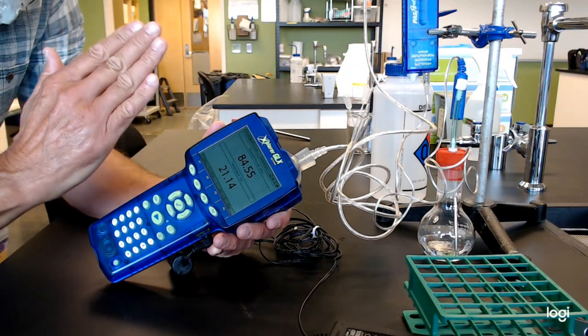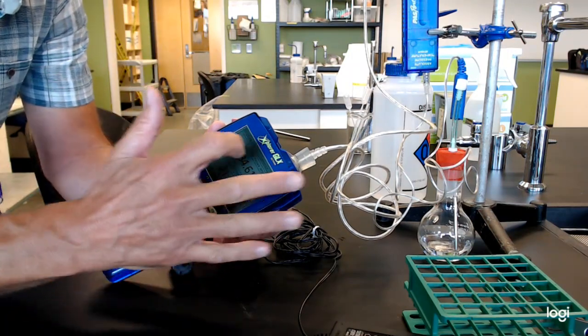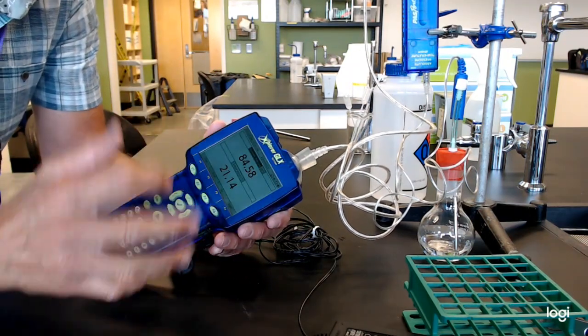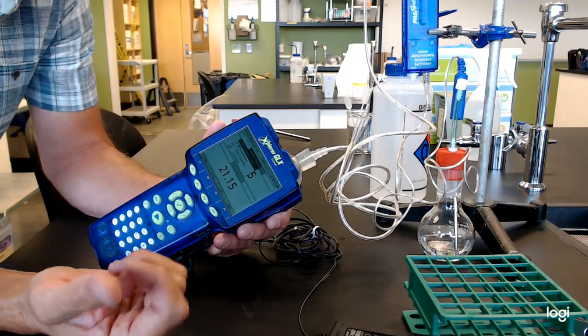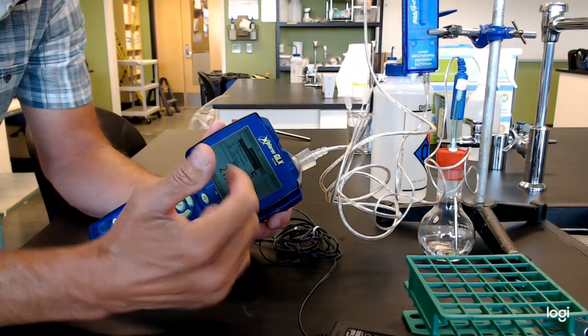But don't despair if it's blank. That doesn't mean that's happened. Make sure you get in here, pull down your screen first and see if the sensors are available.